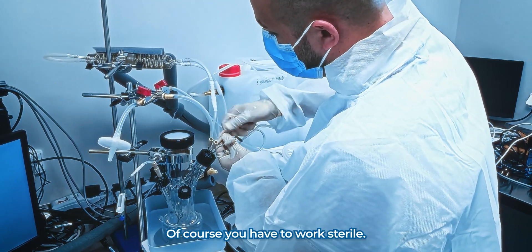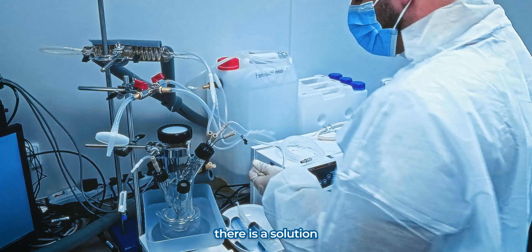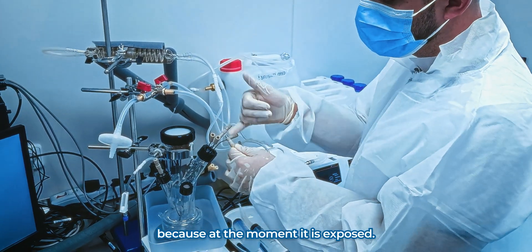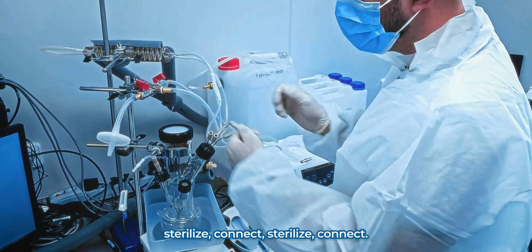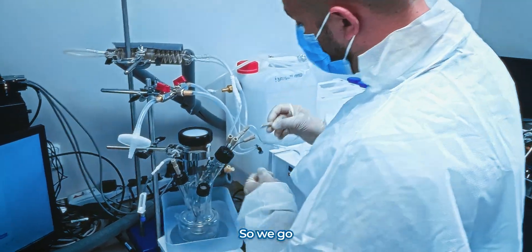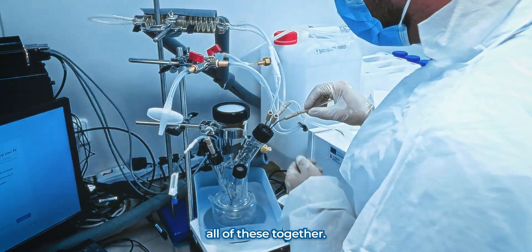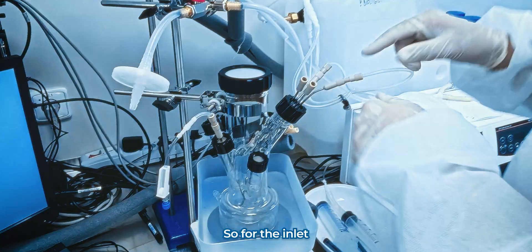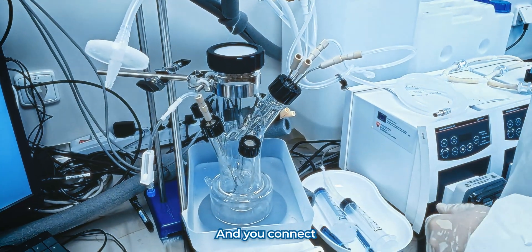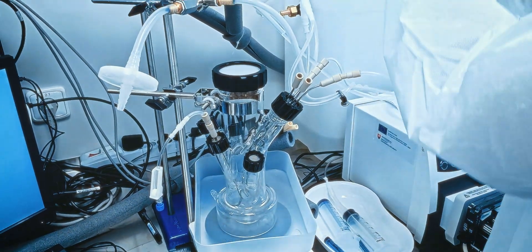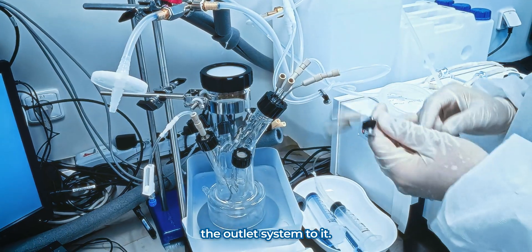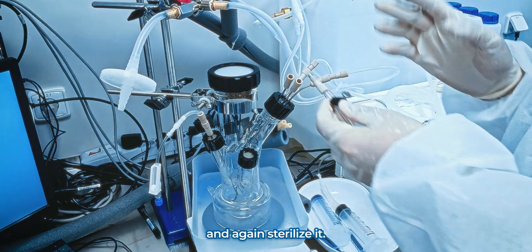Of course, you have to work sterile. So there is a solution when you have to sterilize everything, because at the moment it's exposed. So again, sterilize, connect, sterilize, connect, sterilize, connect. So we go through, you connect all of these together. So for the inlet, then you take your outlet ones and you connect the outlet system to it. Again, connected and again, sterilizing.